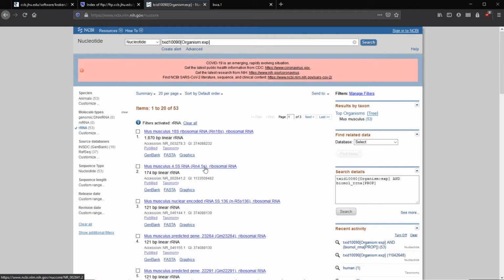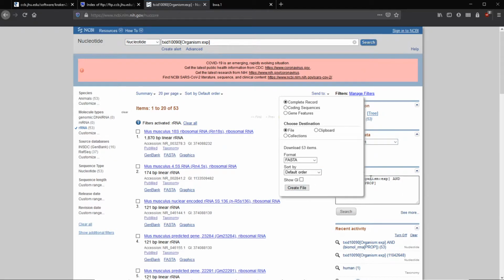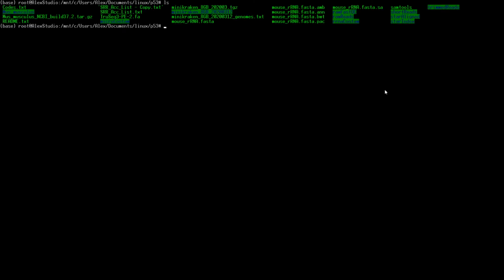So now we have all of the ribosomal RNA for mice, and there's a few different ones, but we can send to file, and then here what we want to select, not showing the drop-down window, is FASTA. Select FASTA, and when we create file, it'll send that to be downloaded. And then what we can do is copy that to our working directory, which is going to be our home directory here with all of our files.